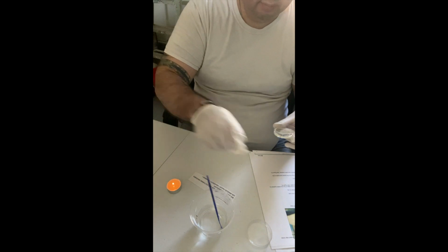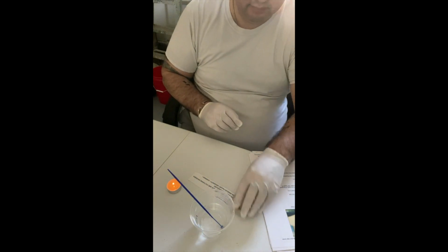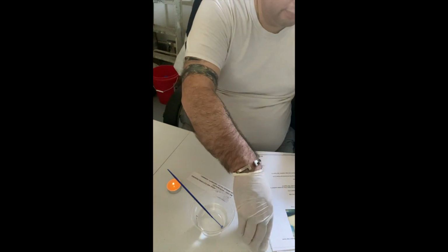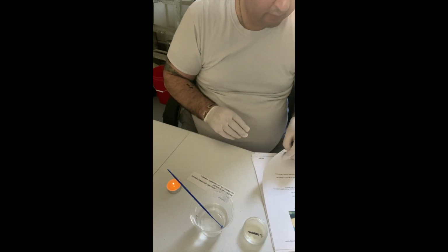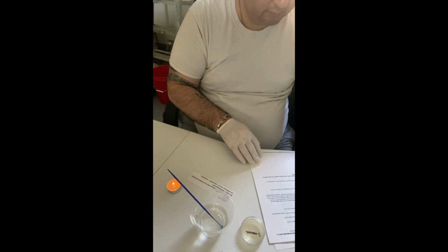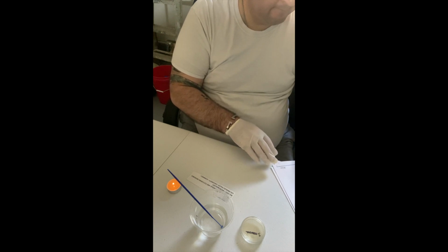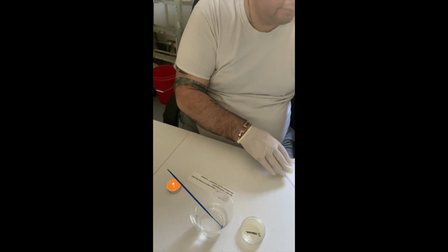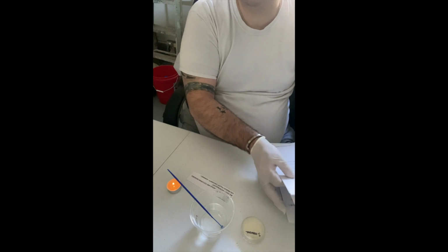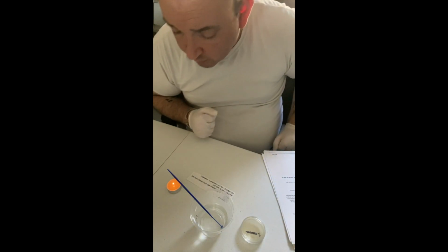Okay, back into the alcohol, we'll give it 20 seconds. I'm going to go ahead and extinguish my candle at this point since I've already flamed all the culture tubes.